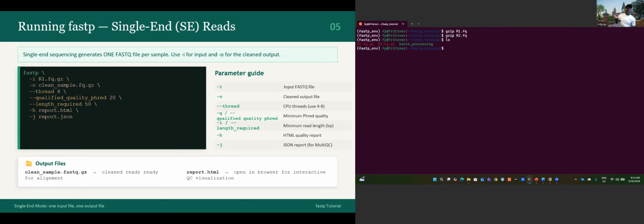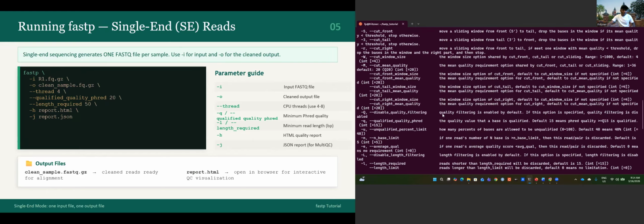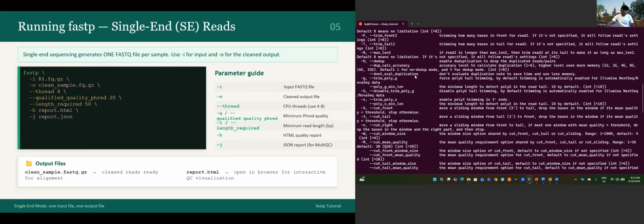So we can do fastp for the single end now. To do that, we need those parameters or flags. How do we know those flags? You can just run fastp --help. This is where you have the flags. You can read carefully to see what you want to use.